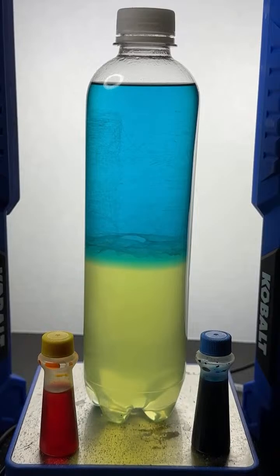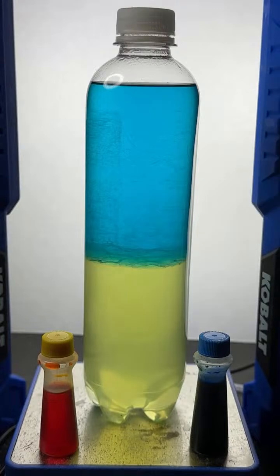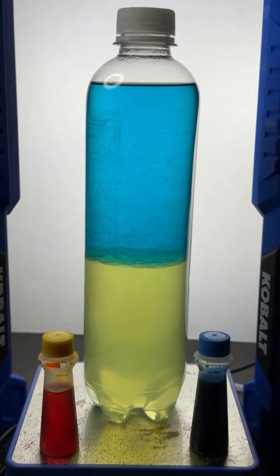Okay, we're going to try this again. We're going to do this experiment again, but instead of using blue, we're going to use some other colors, okay? How did I feel, Shrey? It feels like a puff of cold air when you put your hand in liquid nitrogen. All right, let me get a couple more colors over here, and you guys tell me which one we're going to try. Let me see if I can find them.